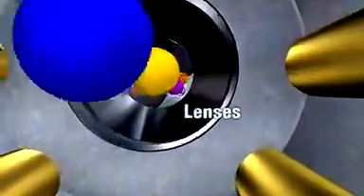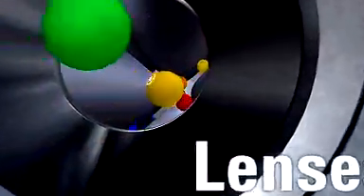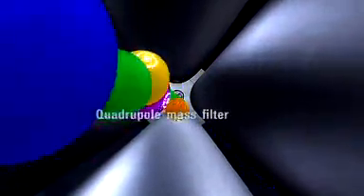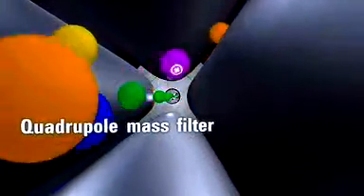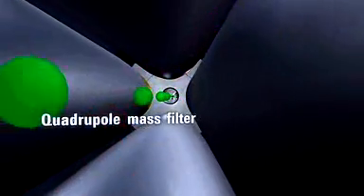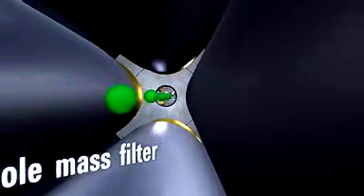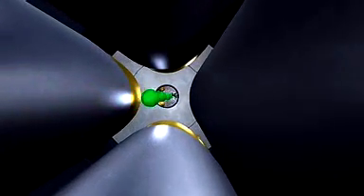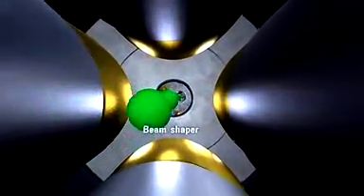Patented lenses enhance high-mass ion transmission and increase sensitivity over a wider mass range. The first quadrupole mass filter allows only ions of the target mass to pass through. The hyperbolic shape of the rods enhances ion transmission and spectral resolution.